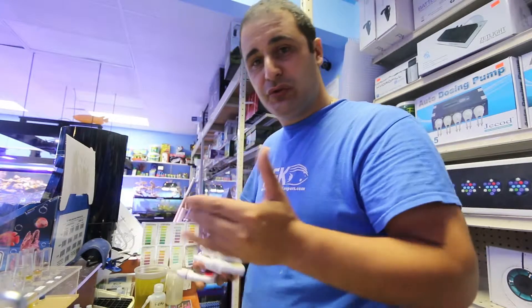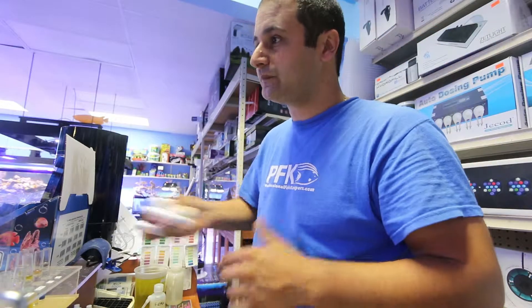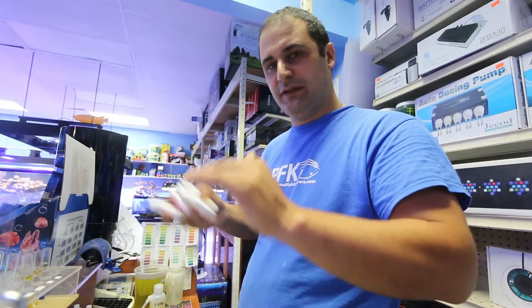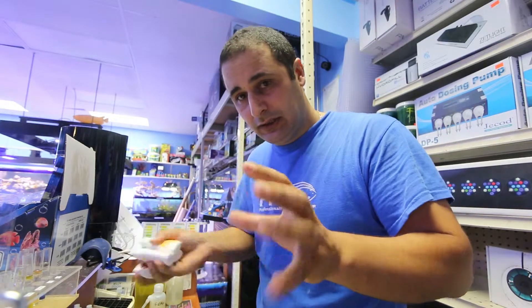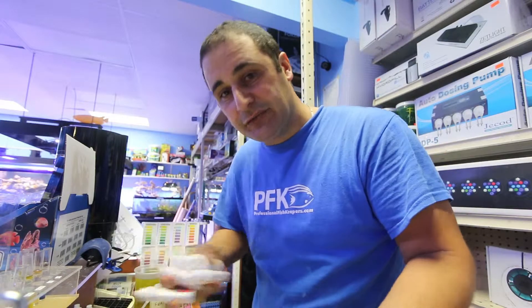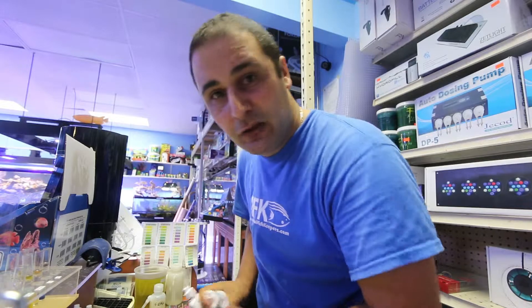For saltwater I'm using the high-range pH test kit, which tests values from pH 7 and up. For freshwater you usually test from 7 down, unless you have cichlids, in which case you test 7 and up since the goal for cichlids is pH 8.0. For other freshwater fish, you're targeting around 6.5 to 7.